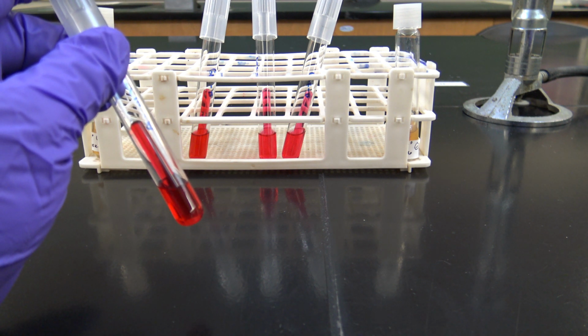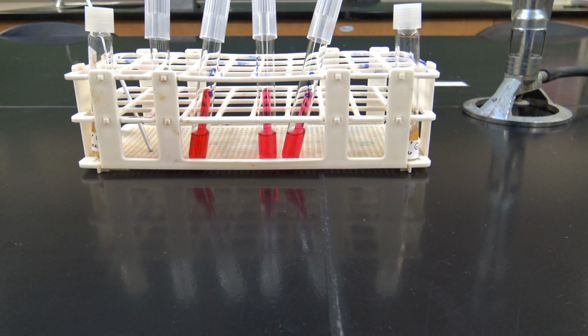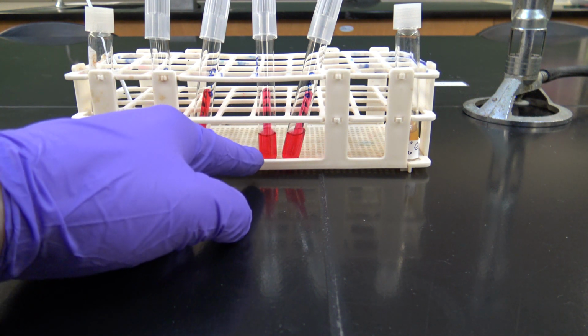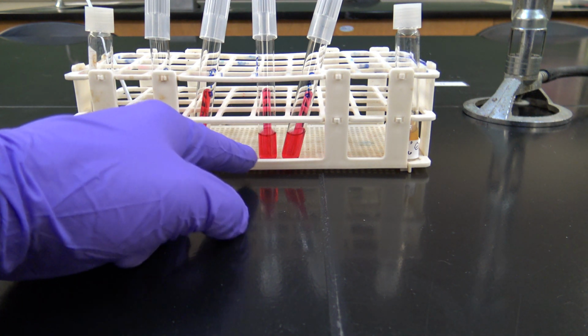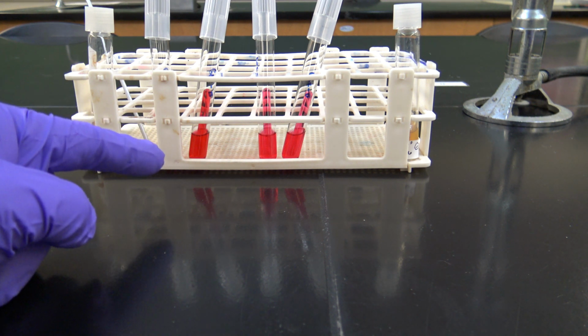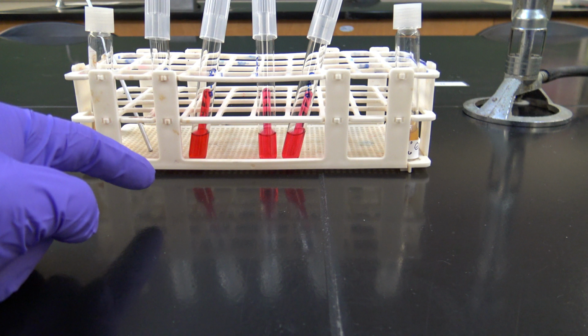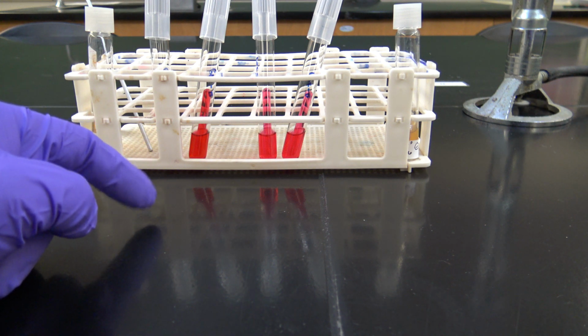When a microbe ferments a sugar, for instance, it's usually going to leave an acid byproduct, and that's going to change the color of the phenol red indicator to yellow. So after we inoculate these today and incubate them for 24 hours, to give them a chance to ferment the sugar or not, we're going to look for a color change.